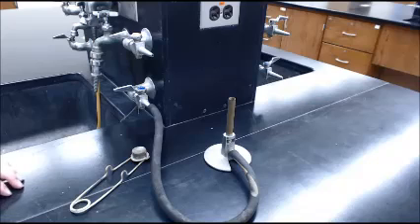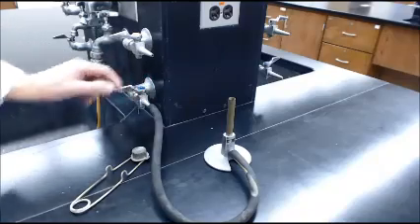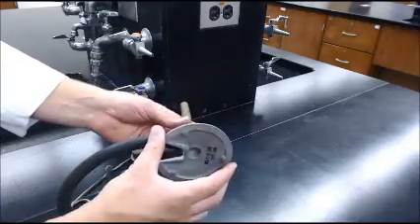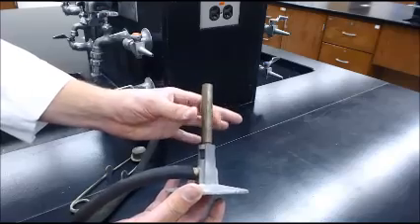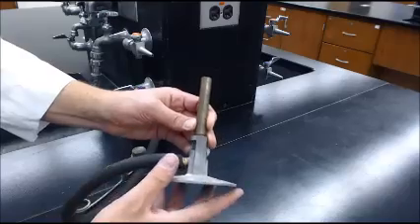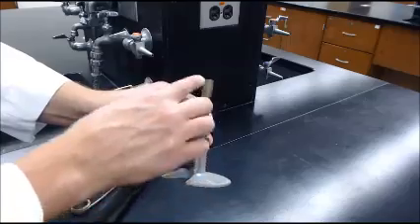This is how we're going to set up the Bunsen burner in our lab. You'll notice here is a gas valve to turn it on or off. This is our Bunsen burner — it's a little bit different from some other videos you may have seen. There is no additional valve; all you can do is open and close the valve stem to let in oxygen through here. The gas comes through the hose and it mixes with oxygen in this area, and that will cause our flame.